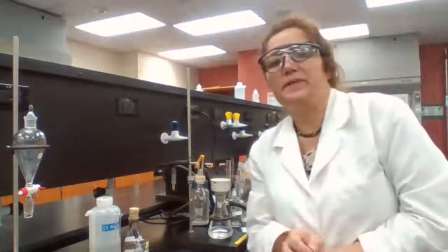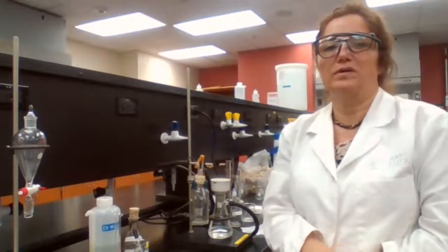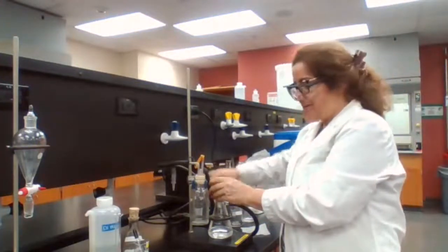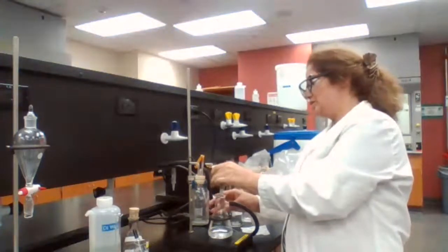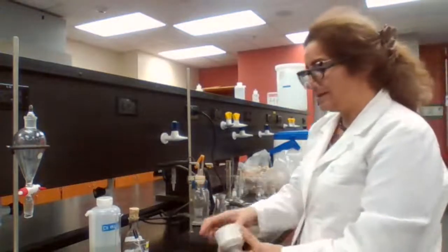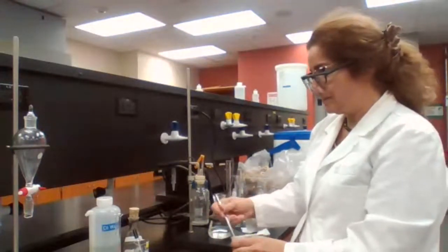Let me know when it's been... It looks like it's been 5 minutes. I said 3 more minutes at 11:04. Okay. We can stop the vacuum. Remove the funnel. Transfer the crystals from the funnel onto the watch glass.